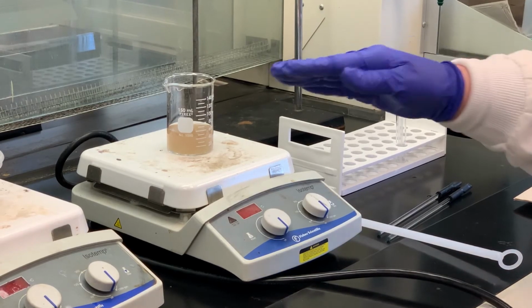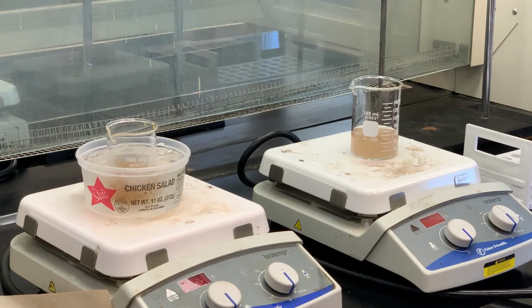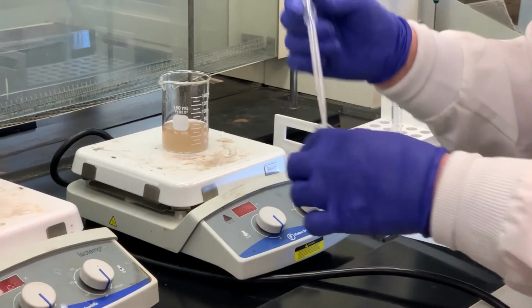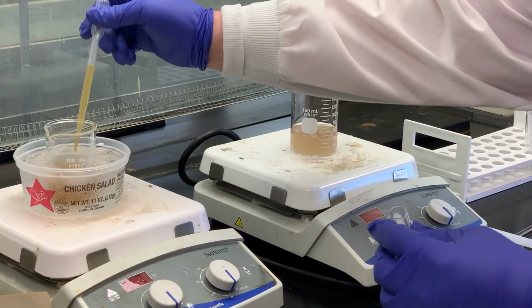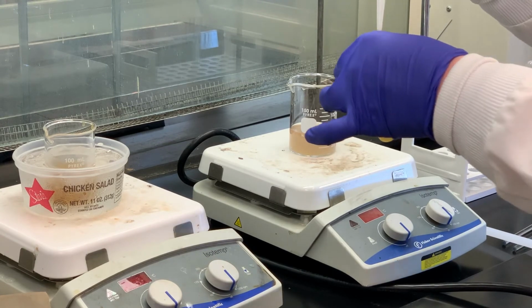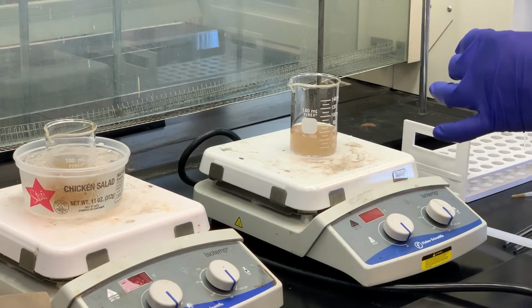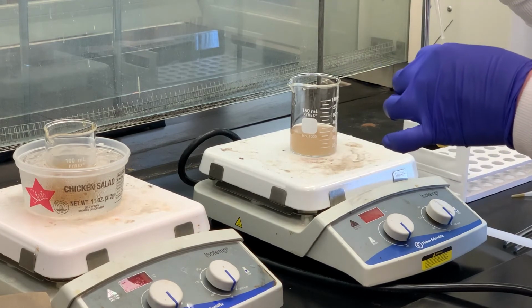Typically, if someone wanted to do this and all they were interested in was making the dye and collecting it, they would add one to the other, stir that for a certain period of time, and then filter the precipitate that forms. What I'm going to do is just do it in a test tube because I want to also do something else with these beakers. So I'm going to take some of my diazonium solution up in a pipette, and it doesn't matter how much. And then I'm going to take some of the coupling component and add to that.